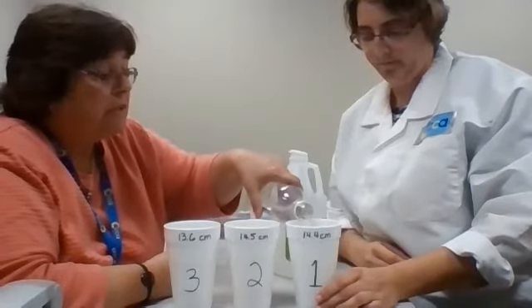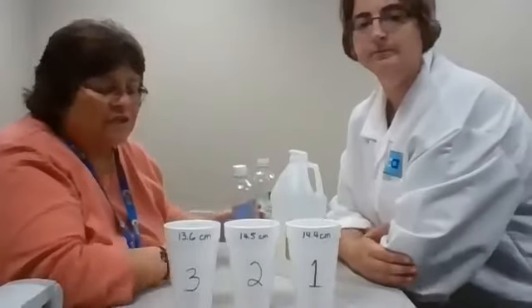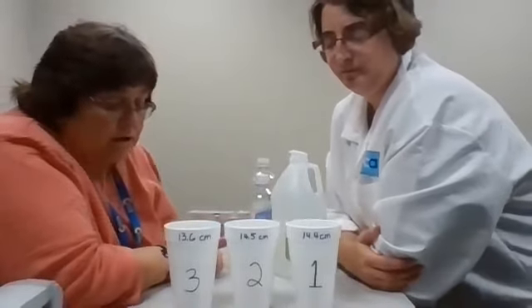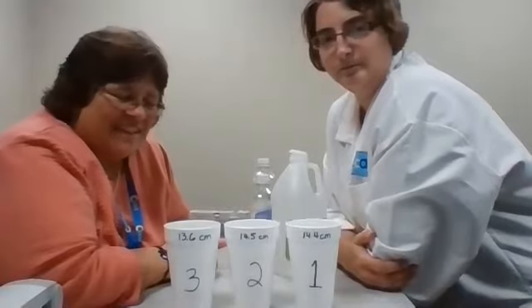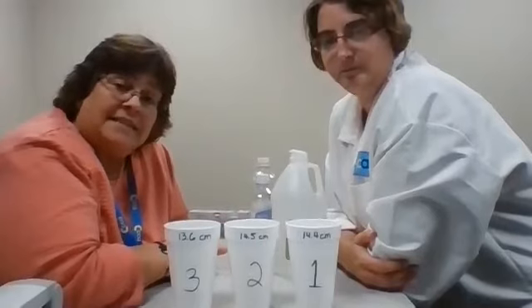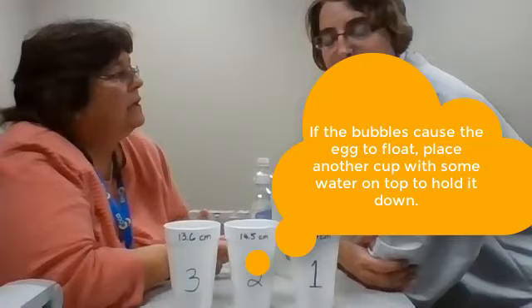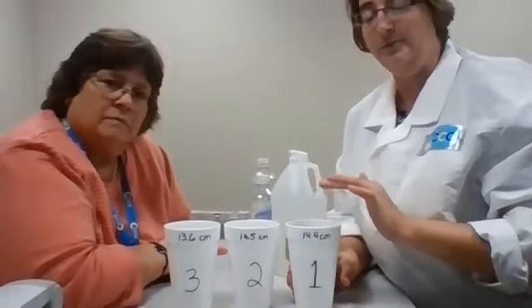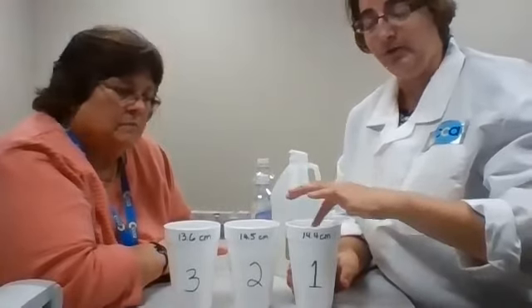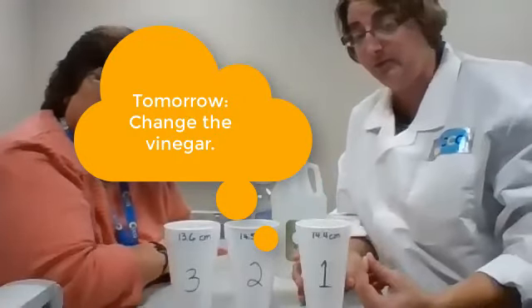So now we've got, even up that one. Now we've got our eggs covered with vinegar. One of the first things that you will see are little bubbles forming on the surface of the egg, and you'll see bubbles rising up to the top. The eggs need to sit in the vinegar for 24 hours, and then tomorrow you're going to want to carefully hold the egg. You may want to use a plastic spoon, not a metal spoon, to hold the egg in place, and then you're carefully going to pour off the old vinegar and put fresh vinegar in tomorrow.